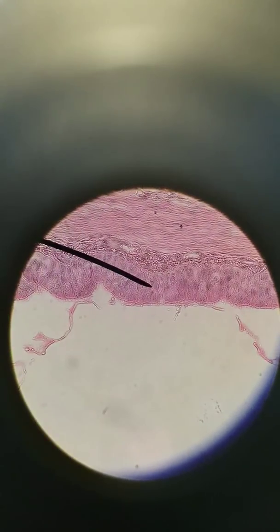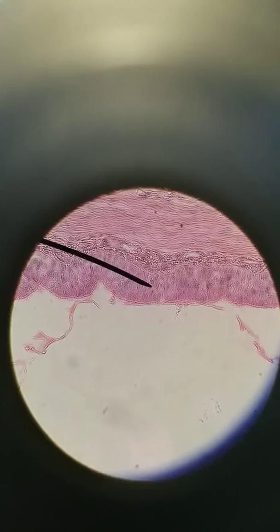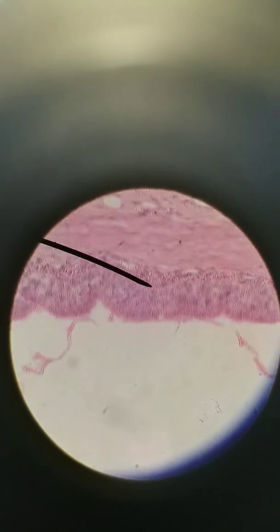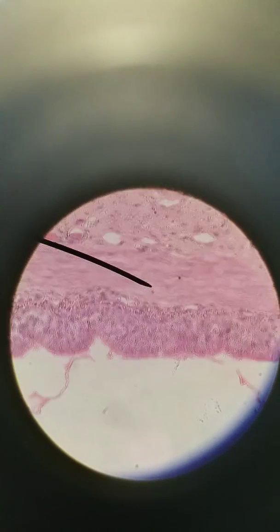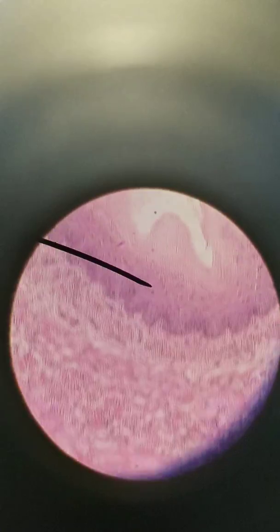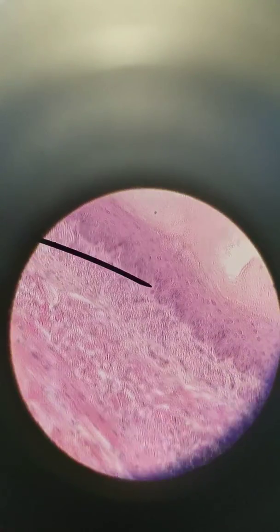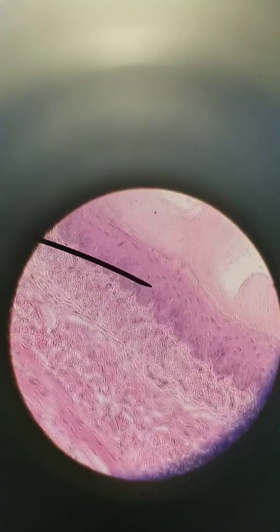And epithelial tissue is always lining something. So there's always an apical side, lining a lumen or a cavity, so this would be the airway, and a basal side, something that's attached to the connective tissue deep to it. Going to the esophagus, similarly, it's a different type of epithelium, but it's still epithelial tissue. Lots of packed cells in this area.